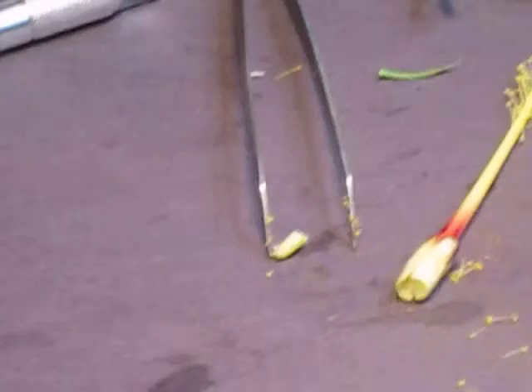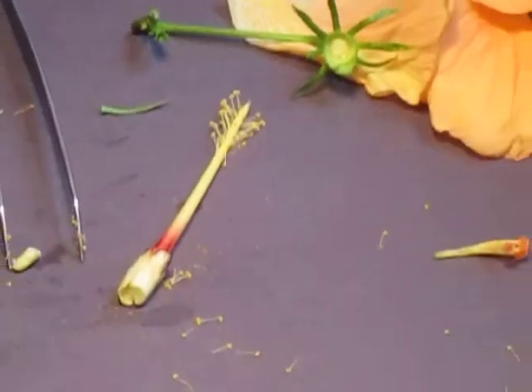If you look right there, you can see a little round thing. That's an ovule. And if you look closely, you'll see there's some more right there. There's a couple, 1, 2, 3, 4, and then down here you can see one right there. So those are the ovules. They're round circles, and they become a seed when mixed with the pollen. And that is basically all there is to dissecting a flower.